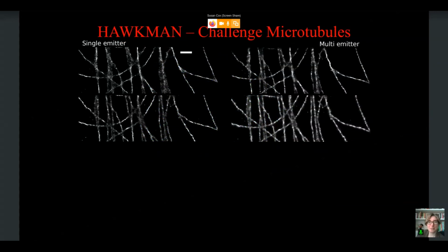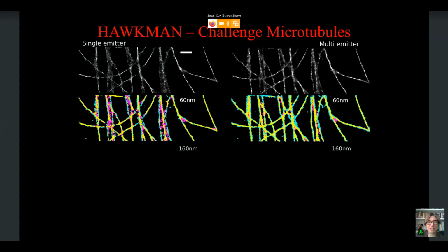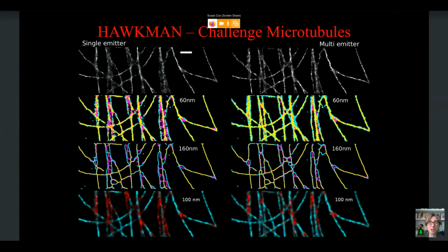So we had a look at some of the challenge data, and I'm showing here the single emitter and multi-emitter, both with and without Hawk. And you can see that for the single emitter and multi-emitter, we're able to see in the sharpening map, I'm showing the sharpening map at 60 nanometers, and I'm showing you the structure map at 160 nanometers. In the paper, we show all the length scales if you want to see them, or it's very easy to reproduce because the plugin is available and the data is available. We just chose these as being the most illustrative and useful things to look at. And then we showed you the correlation maps at 100 nanometers.